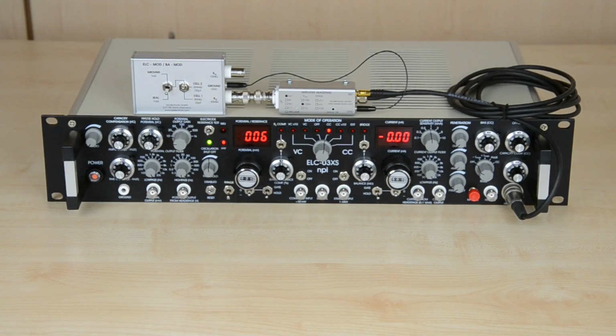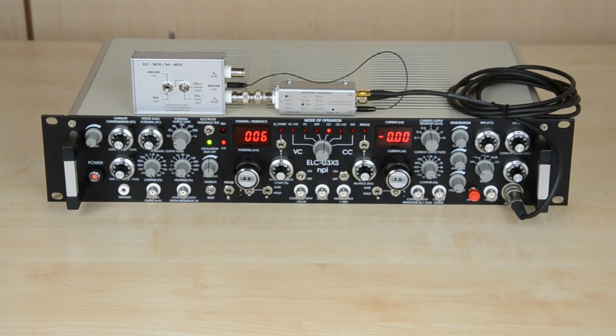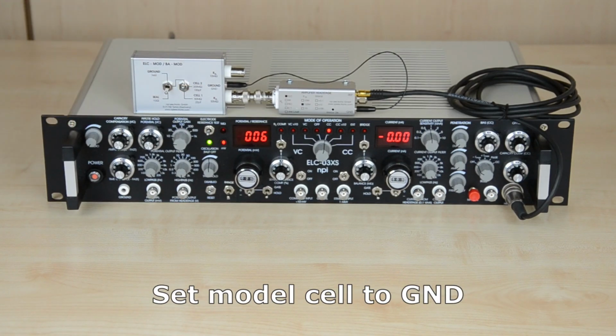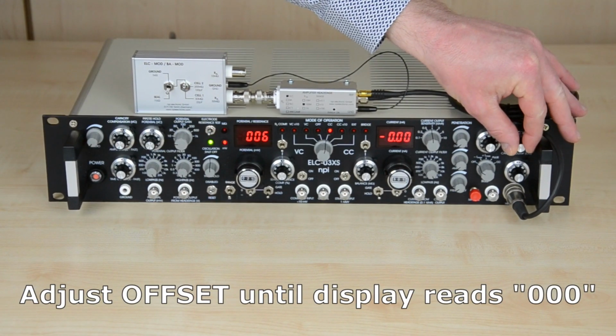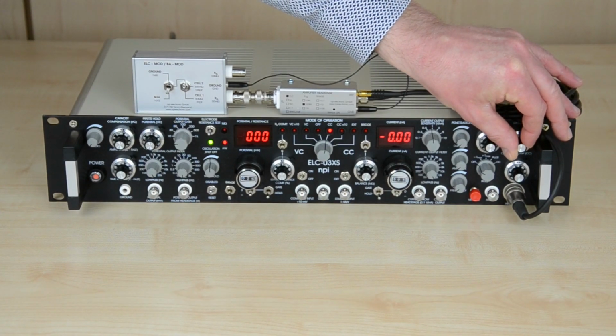To adjust offset and bias using the model cell, make sure that the provided grounding plug for the reference input of the head stage is connected. Set the mode of operation switch to off and the model cell to ground. Look at the potential display. Adjust any offset with the offset potentiometer until the display shows 0.